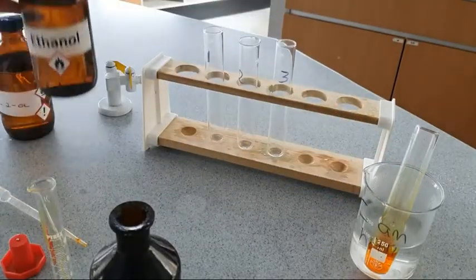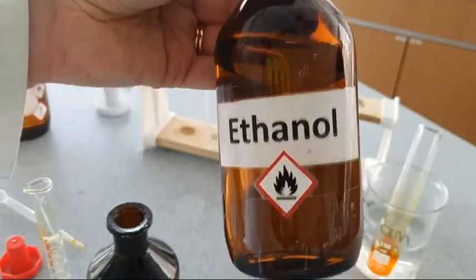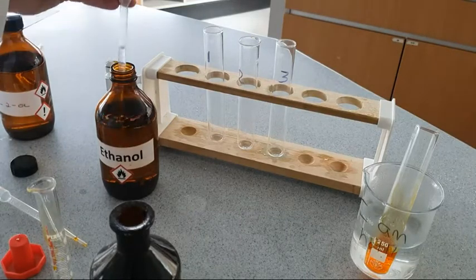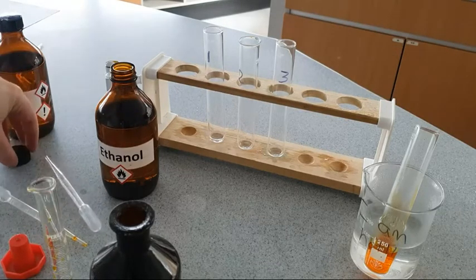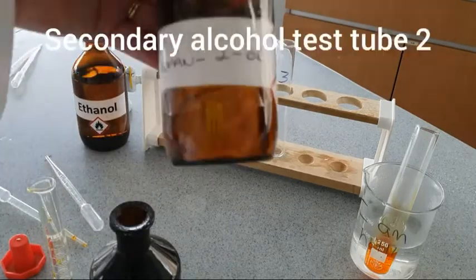We're going to look at three different alcohols. We're going to start with a primary alcohol. We're going to place that in test tube 1, so we're going to use ethanol. We're going to place a small amount of ethanol into our test tube, and we'll also place this into the hot water bath. So ethanol is a primary alcohol, it's one R group.